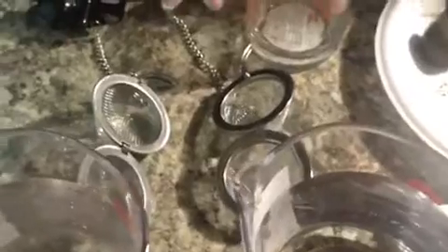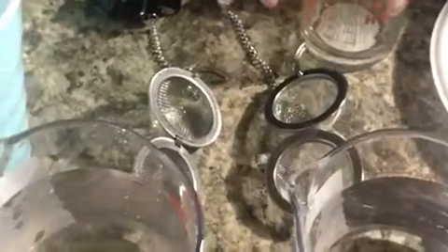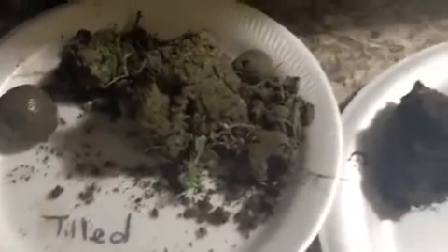Okay, for this method, for this soil aggregate method, I will be taking a tablespoon from each soil sample and inserting them here inside our tea strainer. And I made up an example of a tablespoon needed. So if you were to need this, this is about the size or the amount of soil sample you should have.